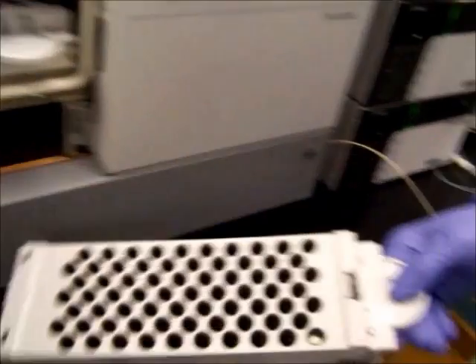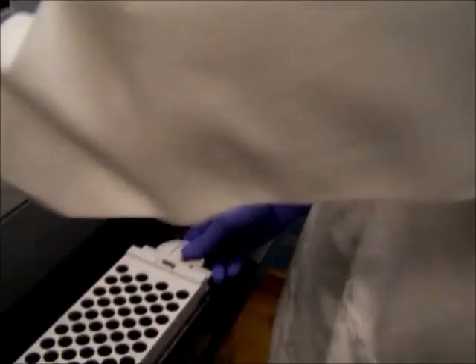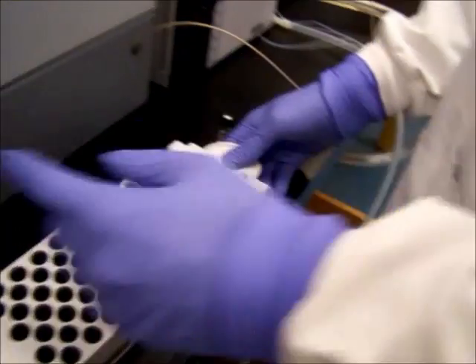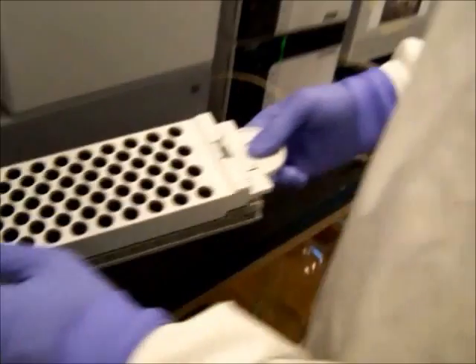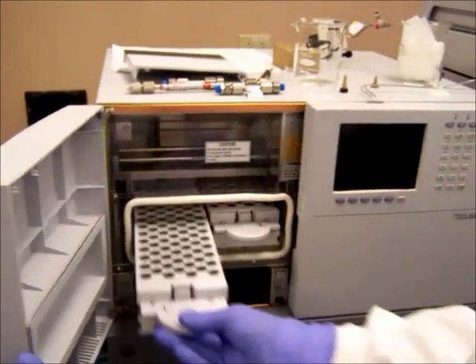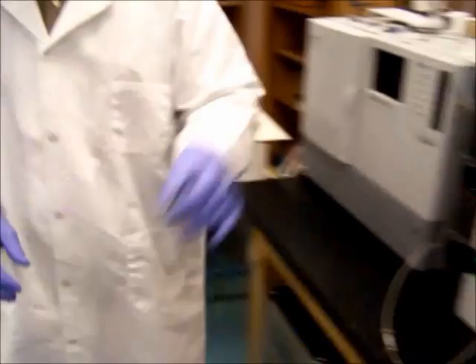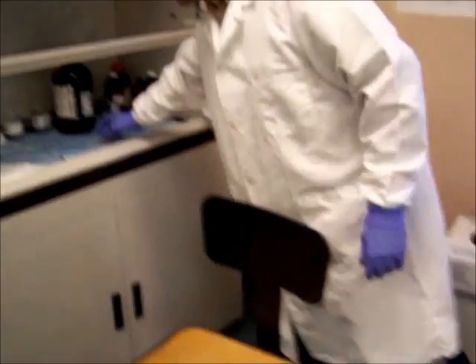Remove your sample. Replace the tray. Dispose of your sample's waste. We'll do this in a little bit.